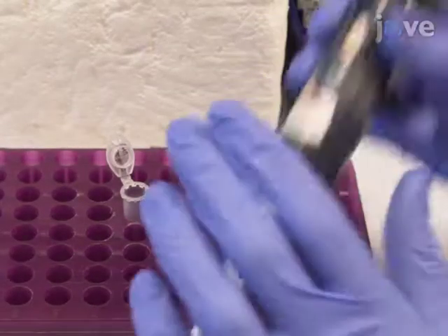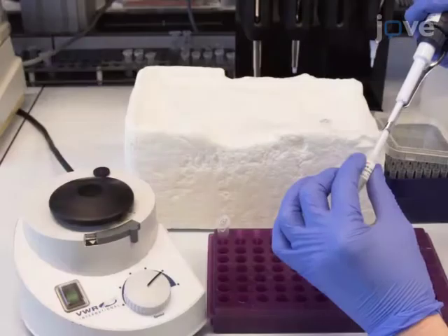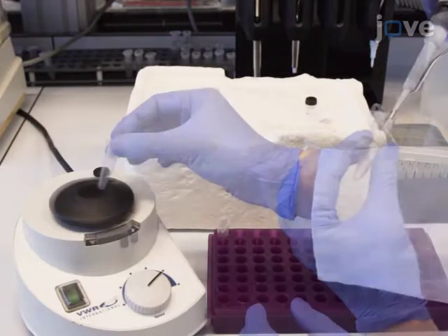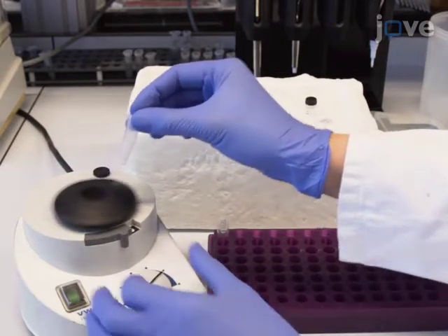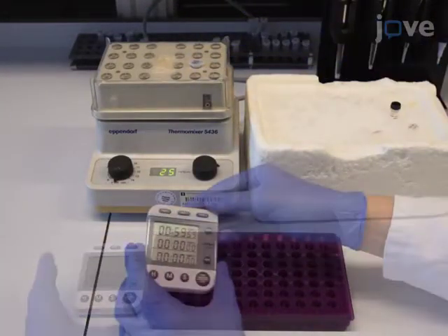Adjust the volume of the mixture to 16 microliters with TE. Finally, add 4 microliters of LR clonase enzyme mix and mix by vortexing. Incubate the mixture at 25 degrees Celsius for 1 hour.